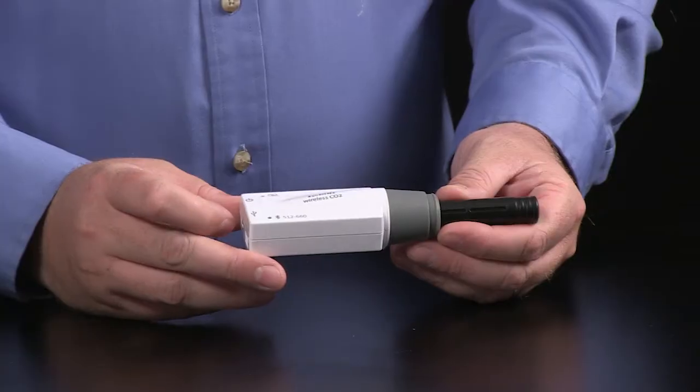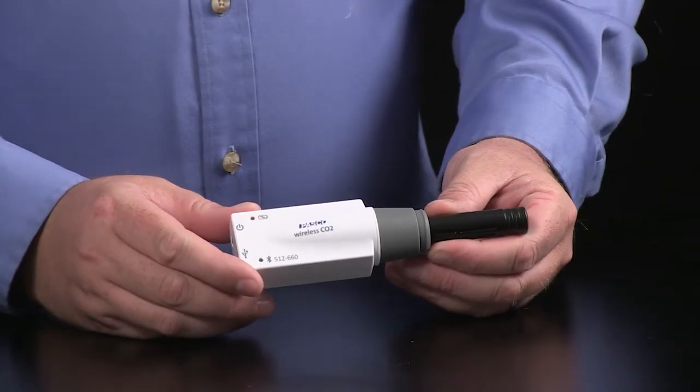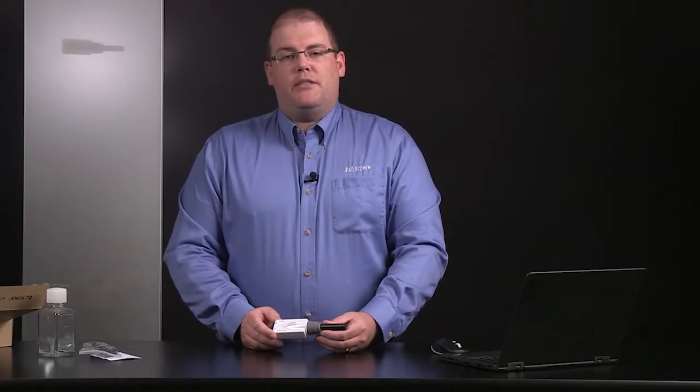Let's go ahead and connect the sensor. I'll power it on. The sensor comes pre-charged, but you may want to top it off if you're going to perform a long experiment. In logging mode, the sensor can run for up to 14 hours continuously, so you shouldn't have any problems getting through a full day of labs.